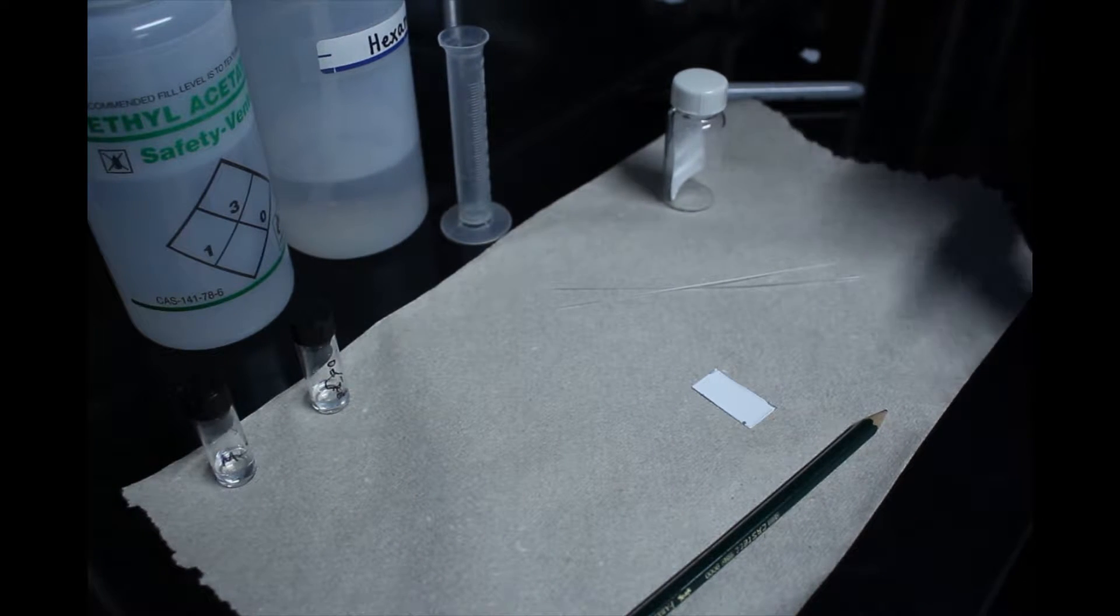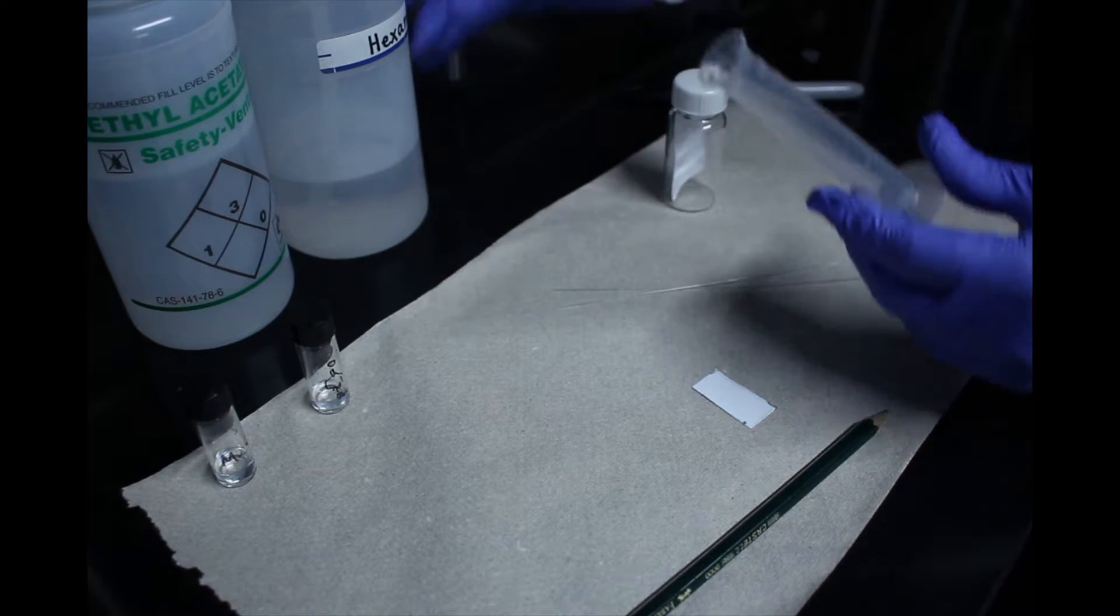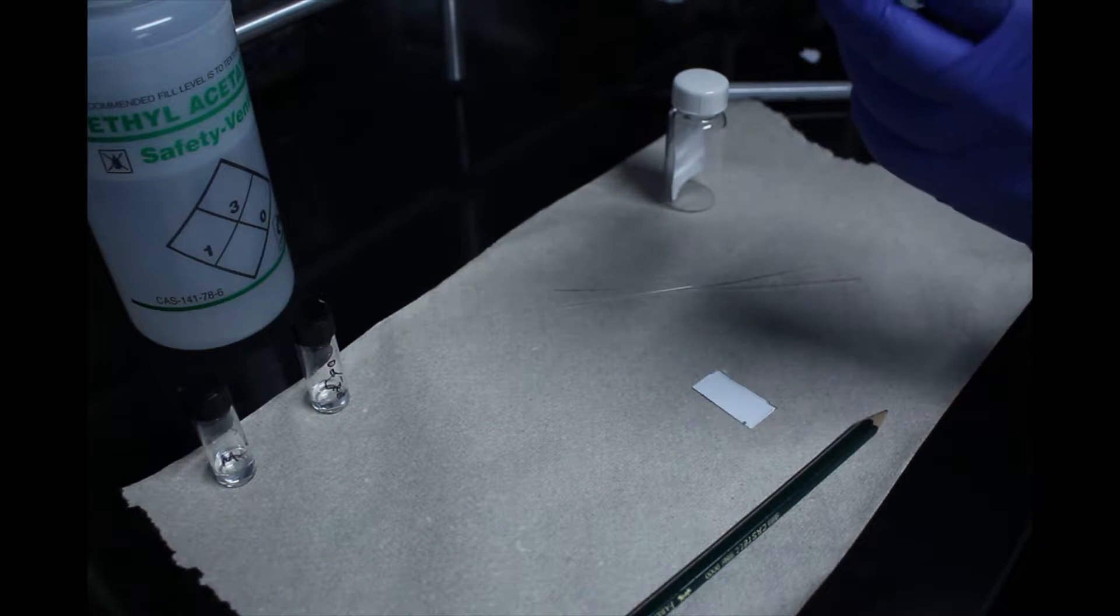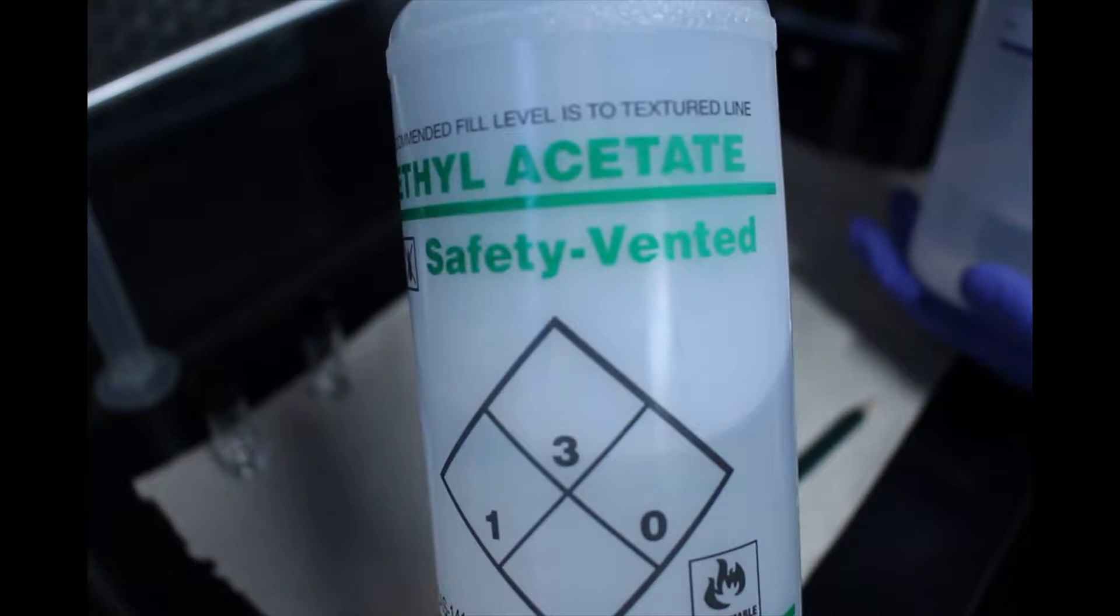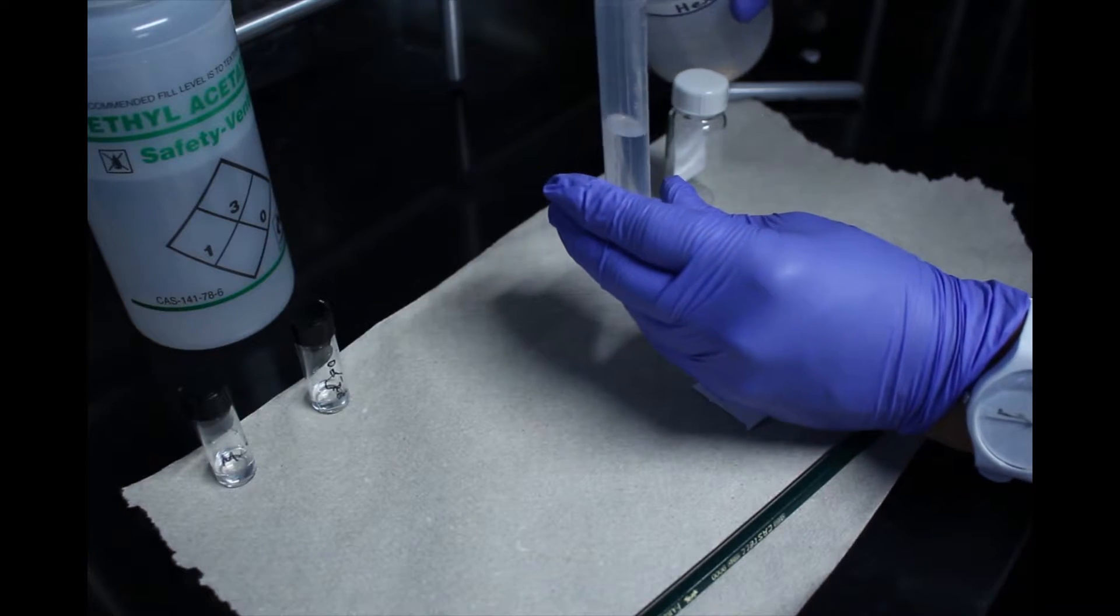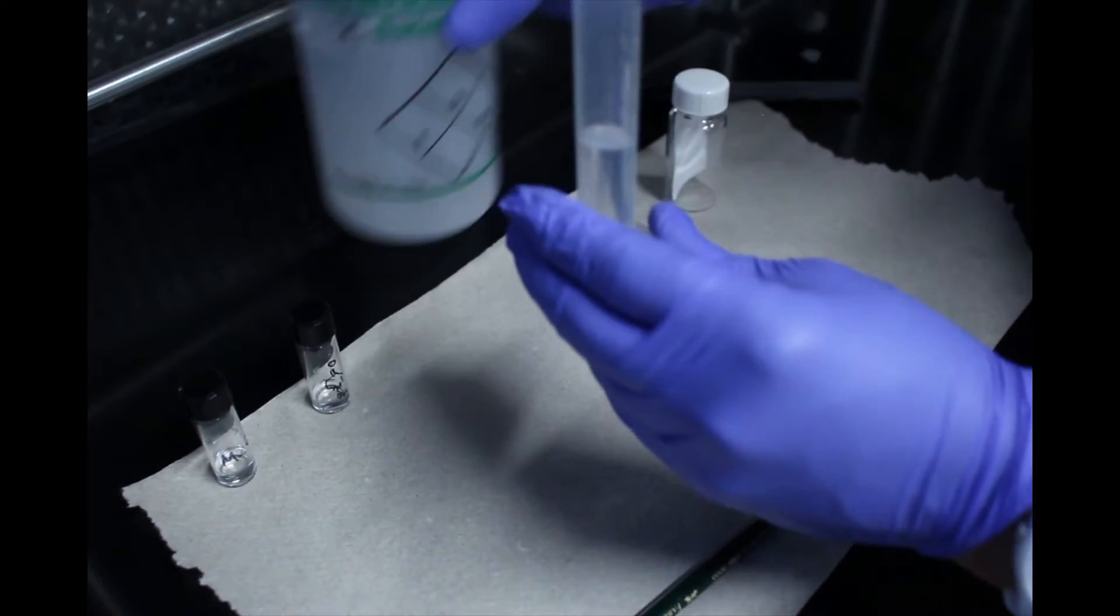When performing TLC, always lay down a paper towel at your workspace. The most common solvent system is a mixture of ethyl acetate, the more polar solvent, and hexanes, the more non-polar solvent.